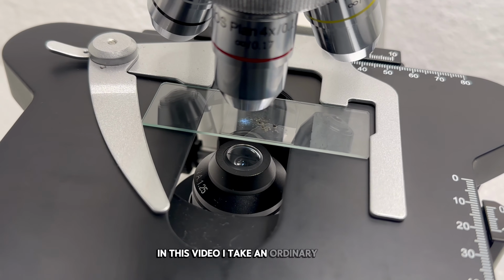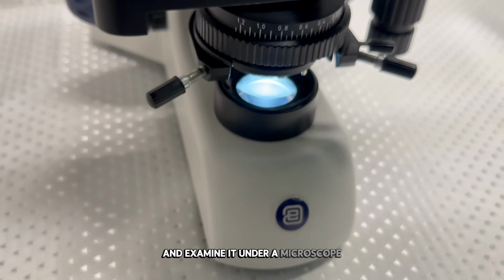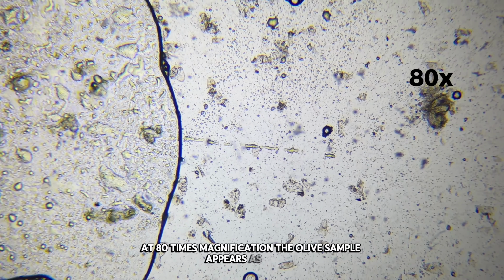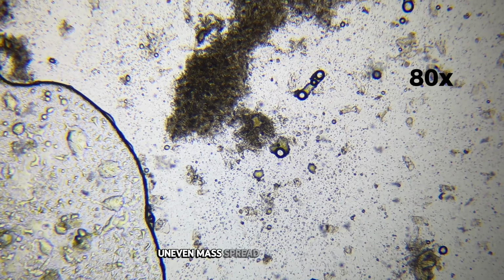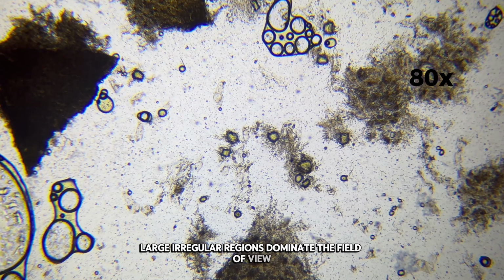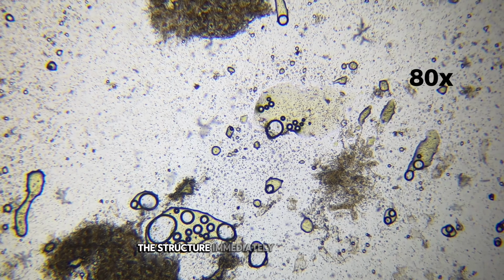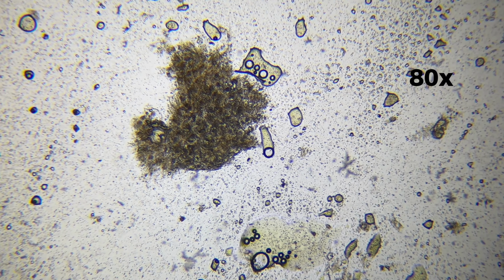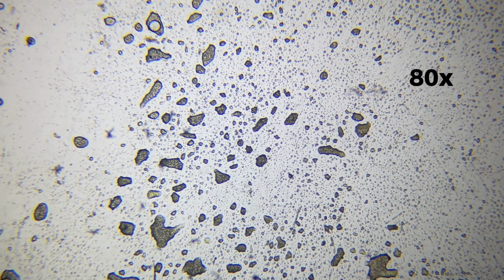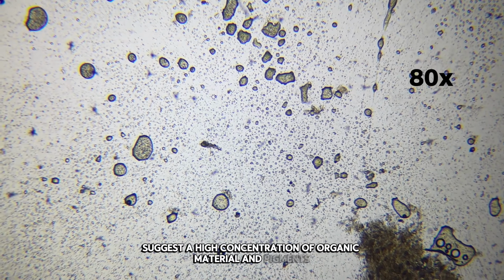In this video, I take an ordinary olive, the same kind people eat every day, and examine it under a microscope. At 80 times magnification, the olive sample appears as a dark, uneven mass spread across the slide. Large, irregular regions dominate the field of view, forming dense clusters with soft, blurred edges. The structure immediately looks heavy and saturated. Unlike fruits with high water transparency, the olive appears opaque and compact. Its dark coloration suggests a high concentration of organic material and pigments.